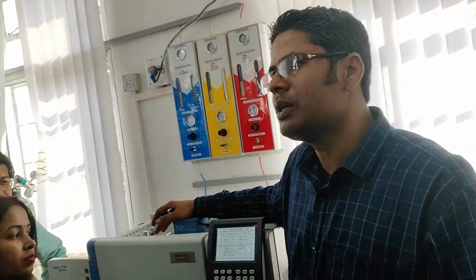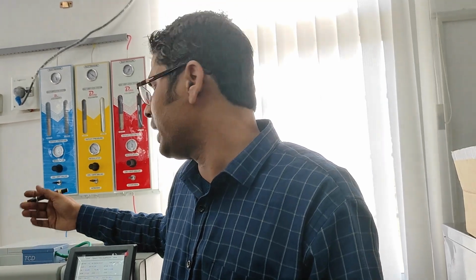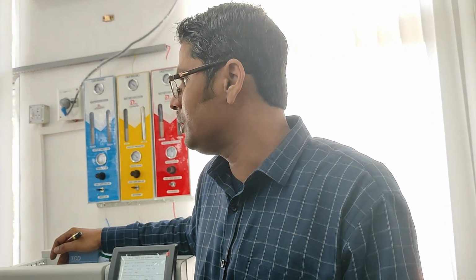Actually, we get a PO from institutes that want to do this type of analysis, so accordingly we make a customized GC. Before getting the order, we get some component names and their possible concentrations, and accordingly we configure it. Now you decide whether other analyses can be done. I already told you these gases can be done. If your sample contains these gases, you can use it.